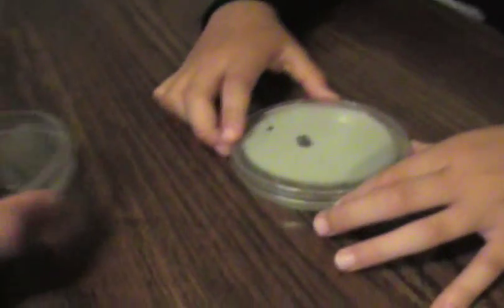We're going to close that up. And then we're going to have to label. We have before hand washing and after hand washing. So we're going to label both of those.